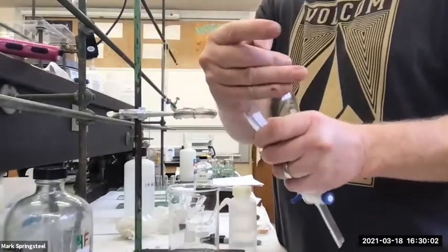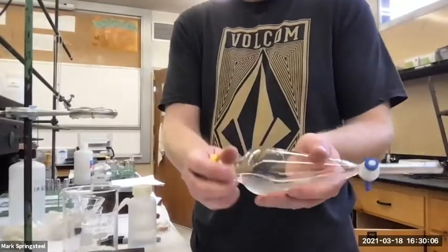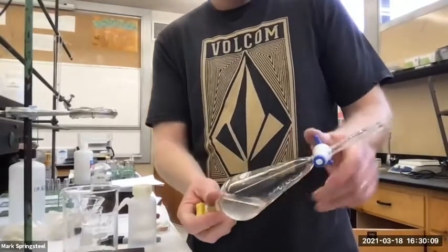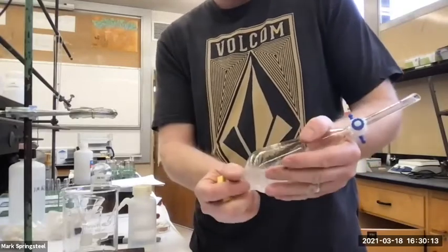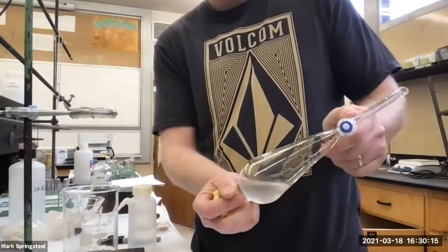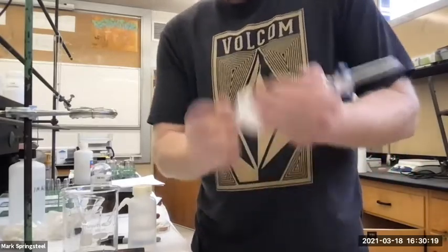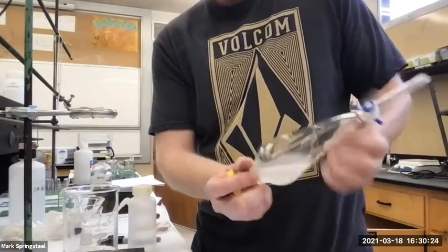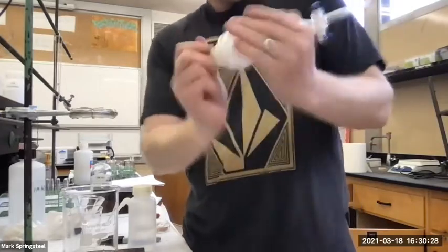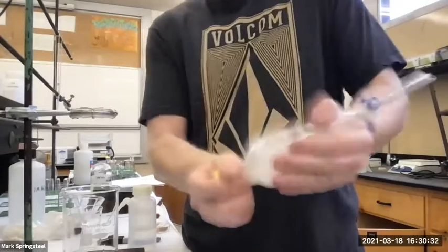Oh, hold it. Shove it this way. Twist it back. Point it at someone you love. No, no one. Little shake. Good. Shake it like a Polaroid picture. There we go. Good.